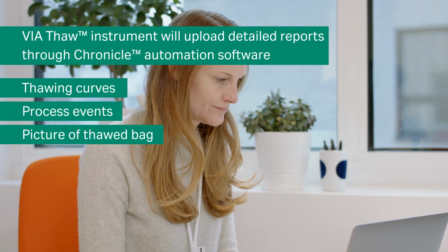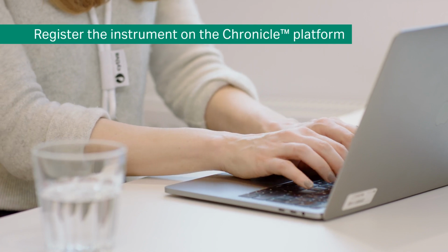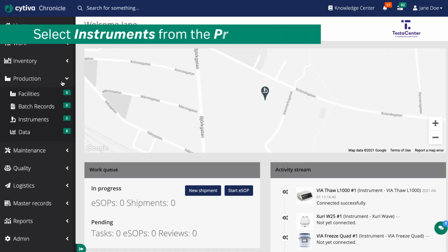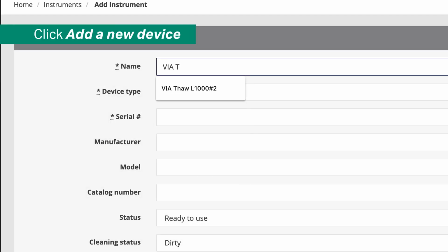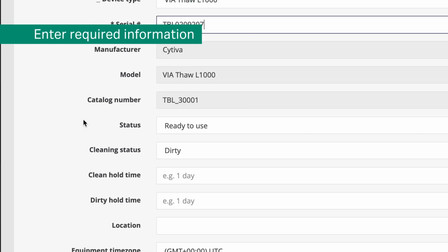Step 1. Register the instrument on the Chronicle platform. Access Chronicle software via pregmp.chronicle.bio or your organization's custom URL and log on. Select Instrument from the Production tab. Click Add New Device to enter a new instrument. Enter the information required for registration.